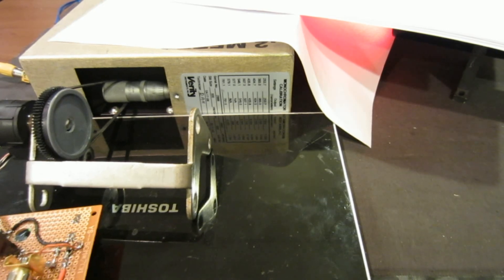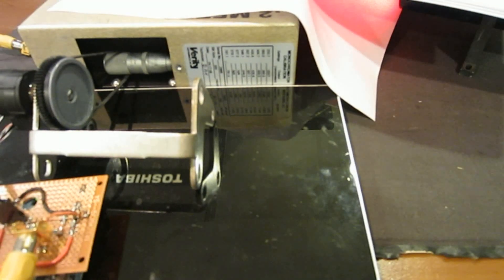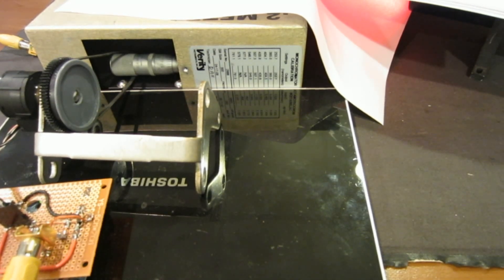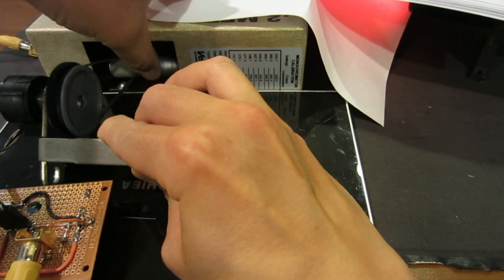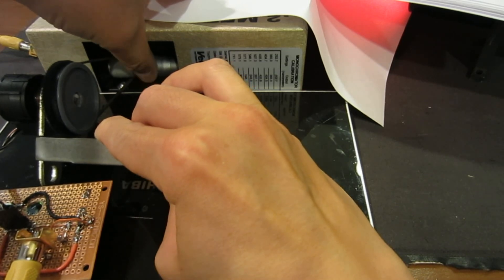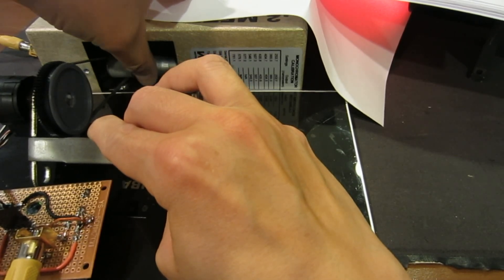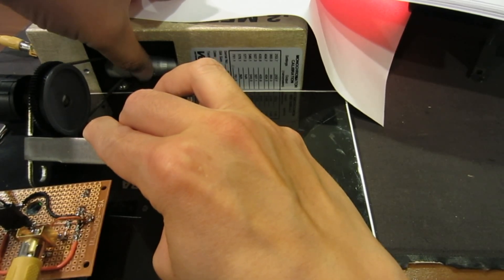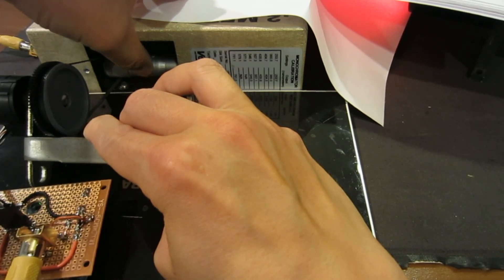After I set this up, you can see the cable is connected. Now I'll turn down the power. I'm going to reset the Arduino so that we make sure we start from zero, then I'm going to start the program. I'm going to gradually turn this wheel so that it increments from the 200 nanometer start all the way to 903 nanometers. The optical encoder is recording the pulses generated by the movement of the micrometer.